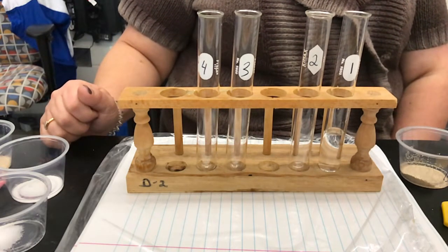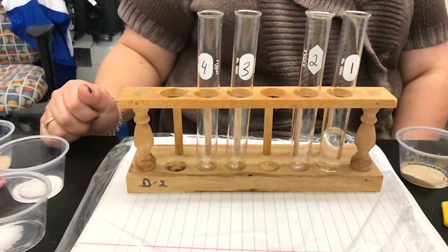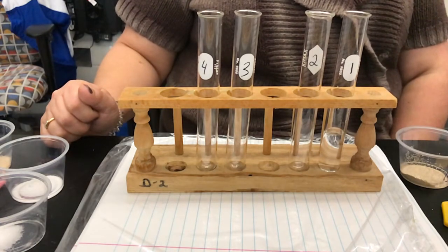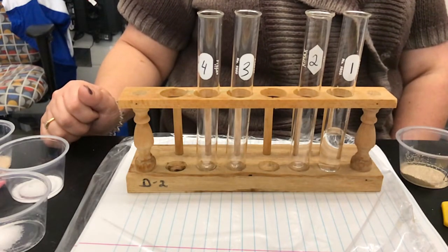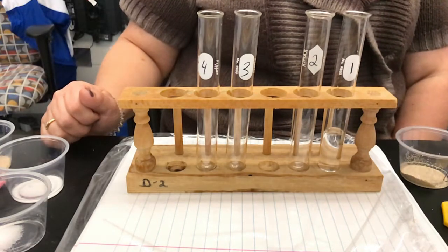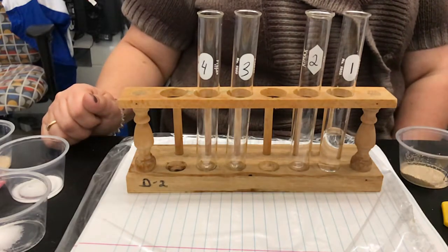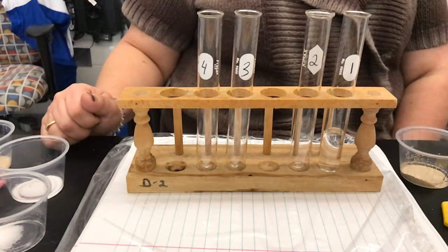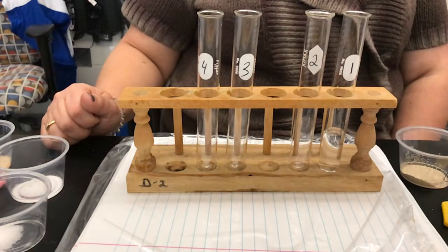Yes, the table. Double-check that the person next to you has 10 ml water in their description.